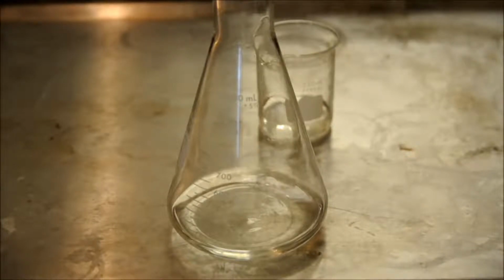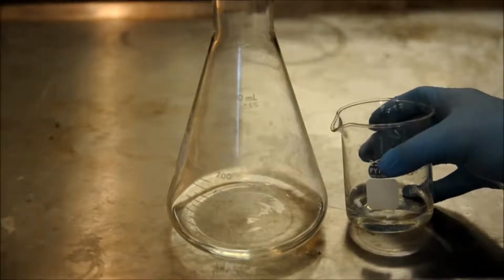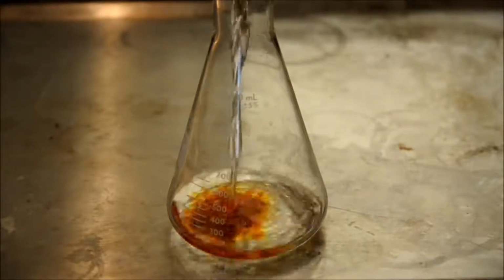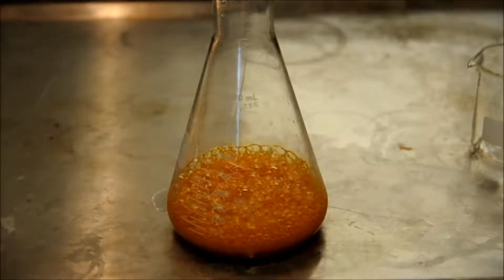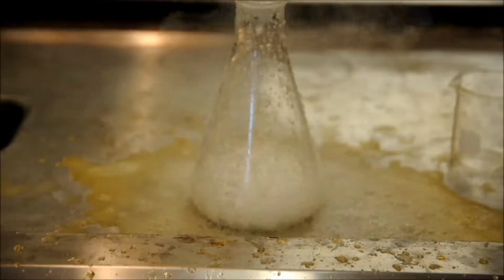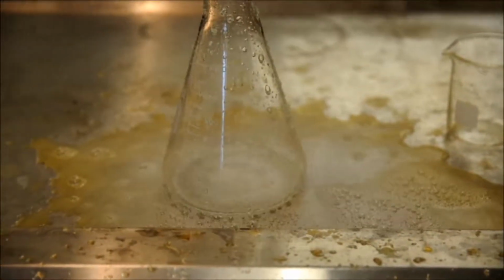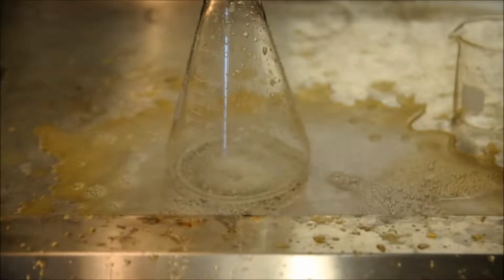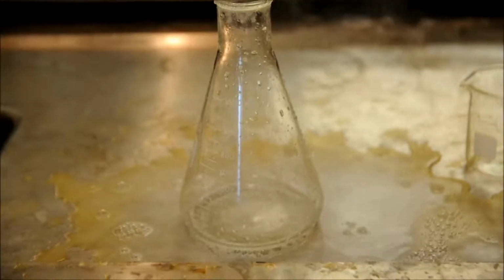Now hydrogen peroxide is naturally decomposing by itself, but we're going to speed up this reaction with the use of a catalyst, which is in this beaker, and the hydrogen peroxide is in the flask. As soon as we add it, we see that it turns a dark brown color, and that is our reaction intermediate. It bubbles and it turns clear again because our reaction intermediate is used up in the second step, and it turns into water and oxygen gas. All those bubbles were oxygen gas bubbles, and the clear liquid is water.